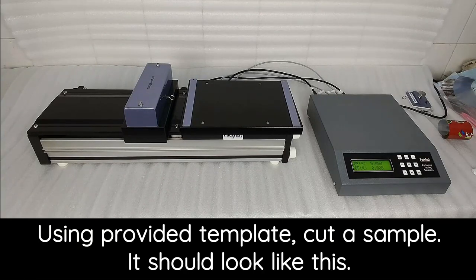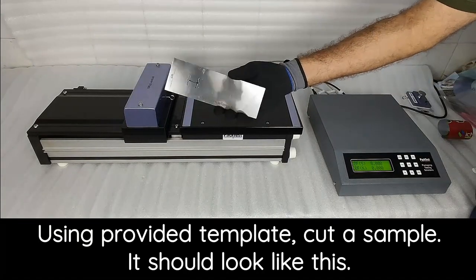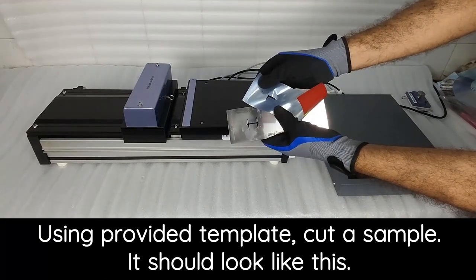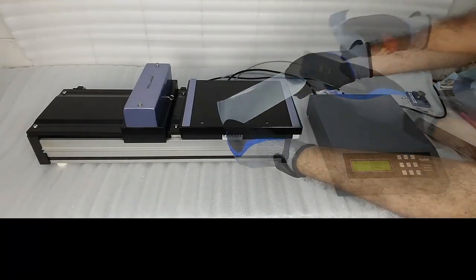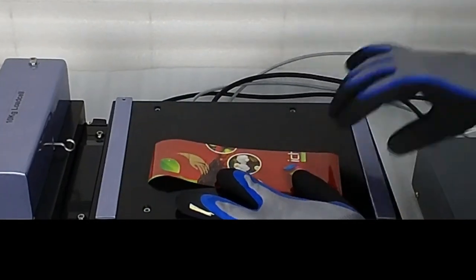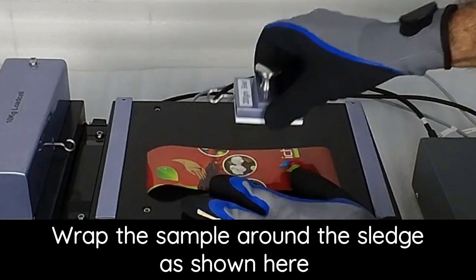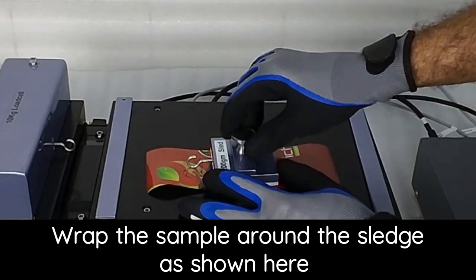Using the provided template, cut the sample — it should look like this. Wrap the sample around the sled, as shown here.